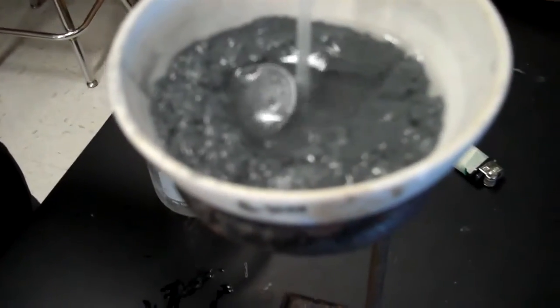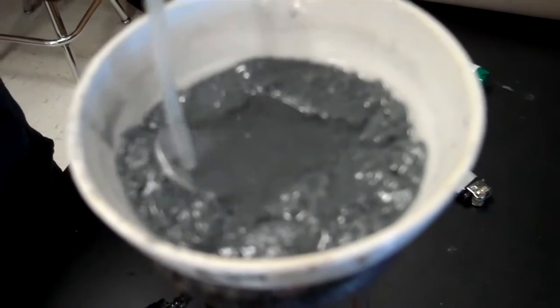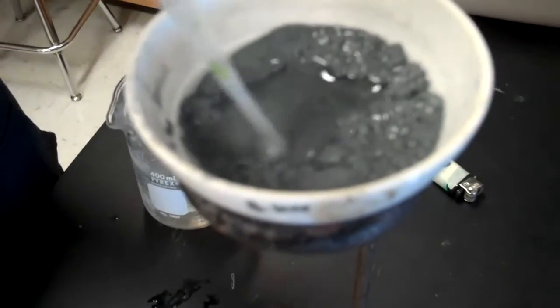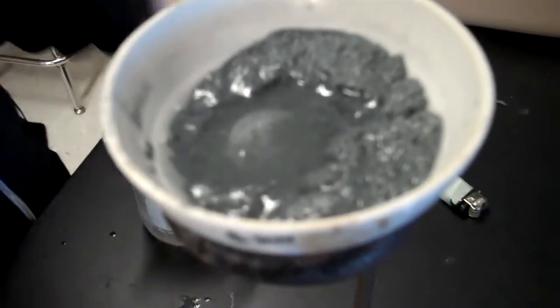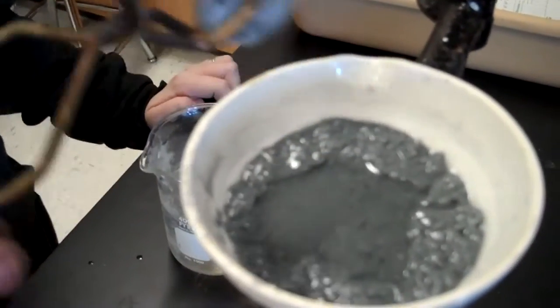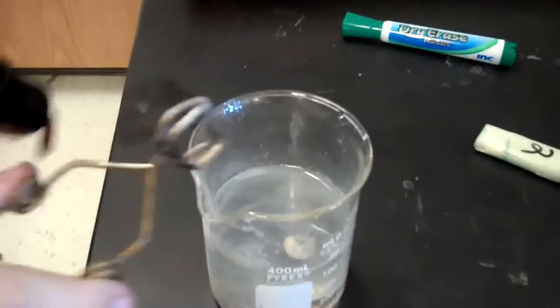All right. We take the penny and flip it over and make sure it's evenly coated in the zinc and sodium hydroxide solution. We're causing a single replacement reaction to occur where the zinc will replace the copper on the outside of the penny. Now we're removing the penny and dropping in some water, and then we're going to pull it out.